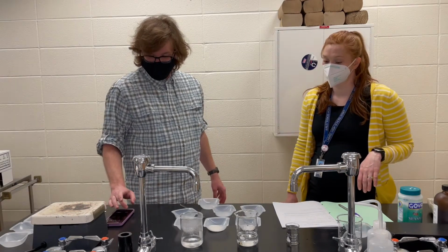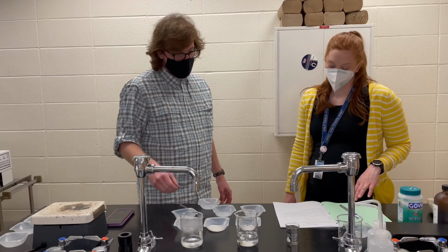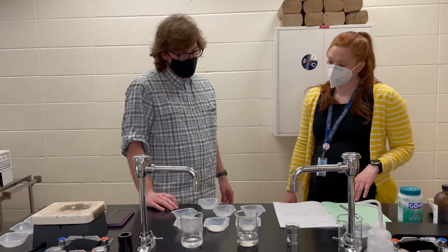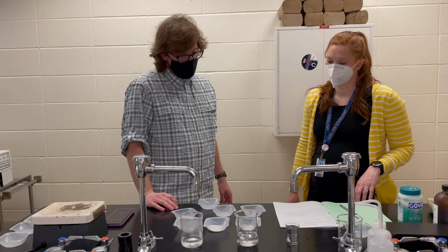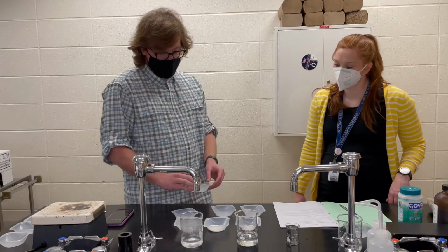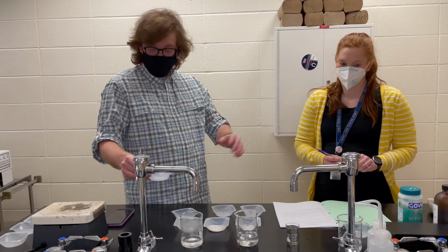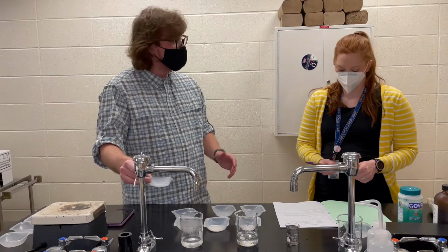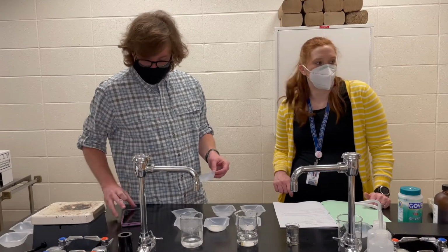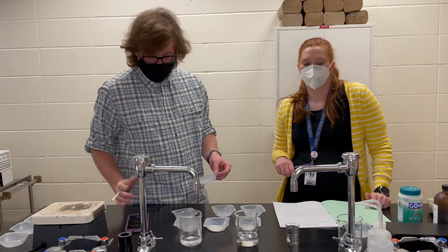I'm gonna go ahead and get my stopwatch going. In this section, we are going to just dump our salt in. And are we supposed to stir? I think we do stir in this one. We are going to stir these, just to try to stir evenly, and make sure I'm not giving any more stirring to one or the other. Try to have an equal amount of stirring to keep as many variables the same as possible. But also, hopefully, stirring will help speed the process up a bit. So maybe we'll investigate that later.